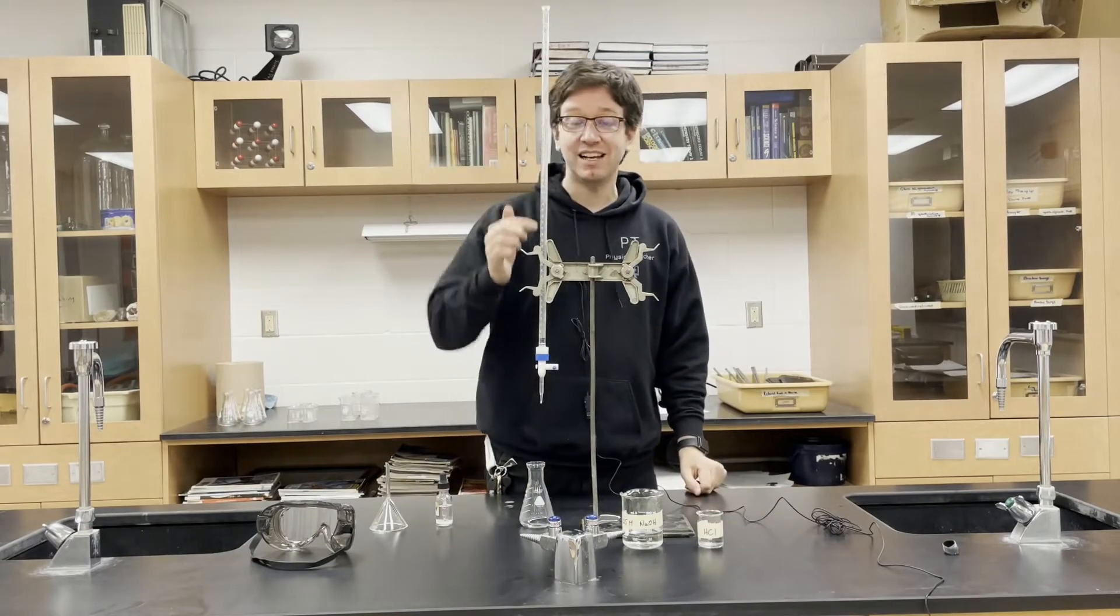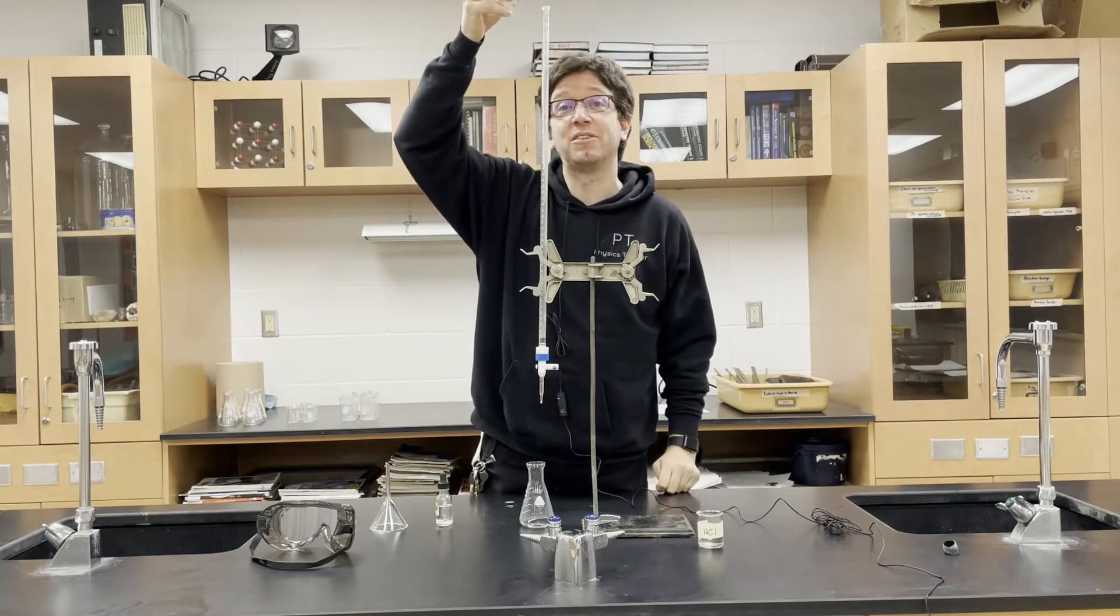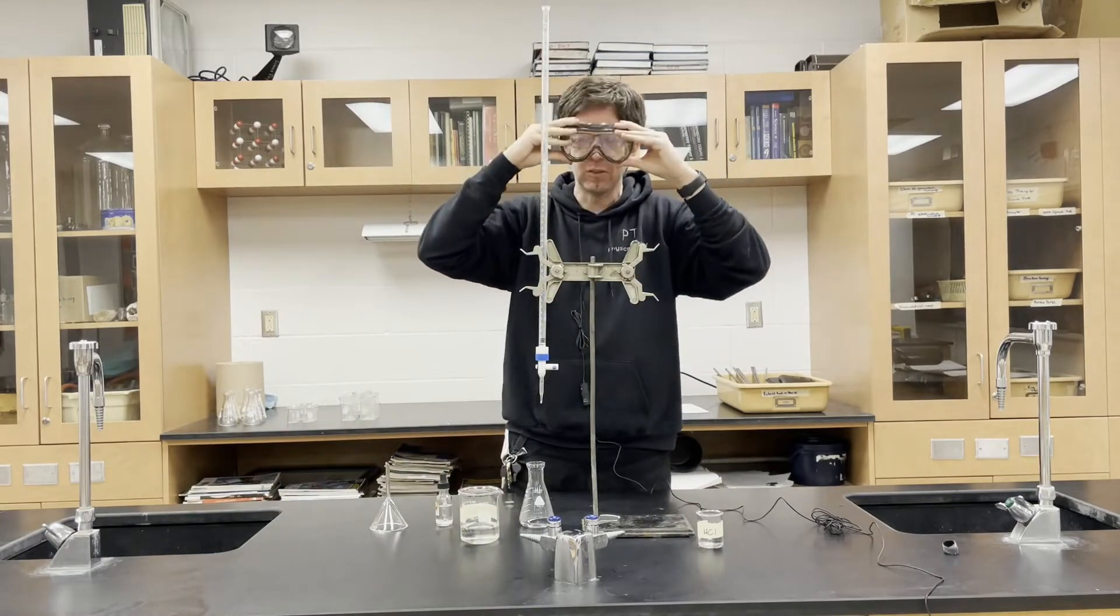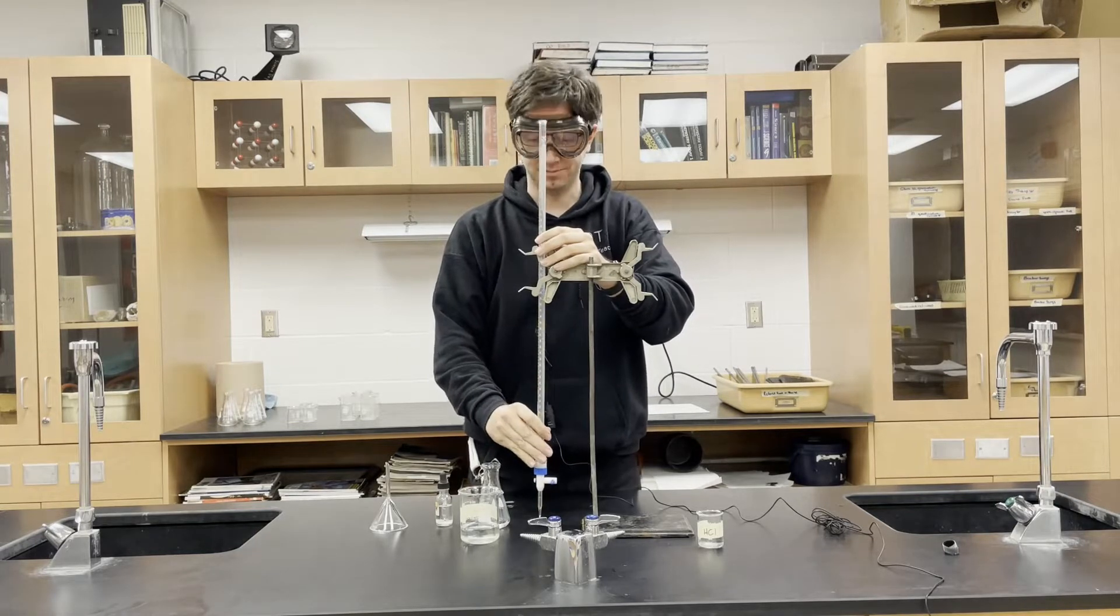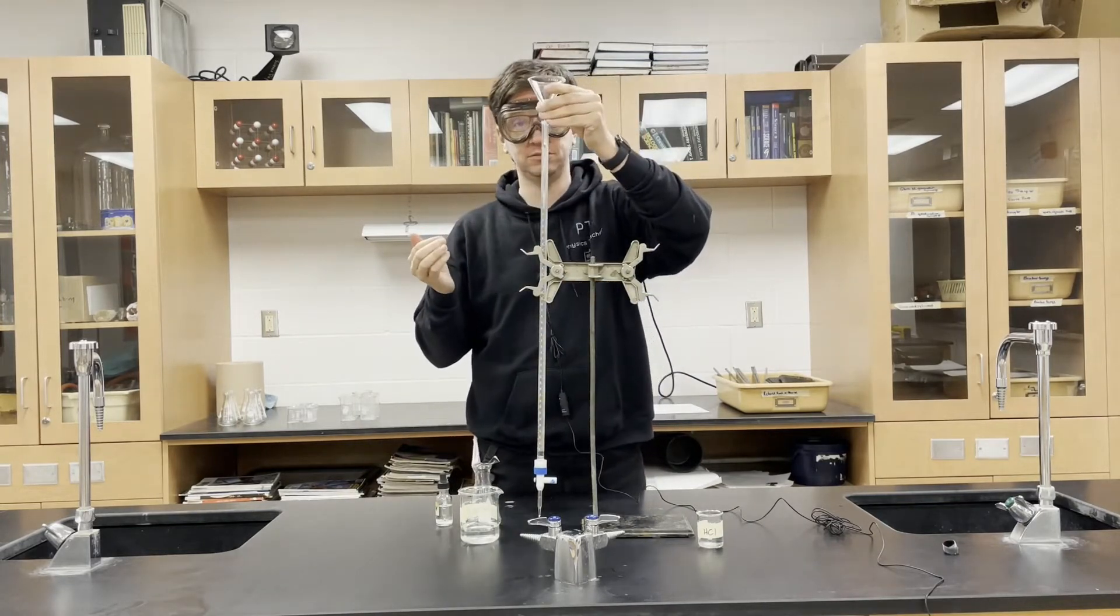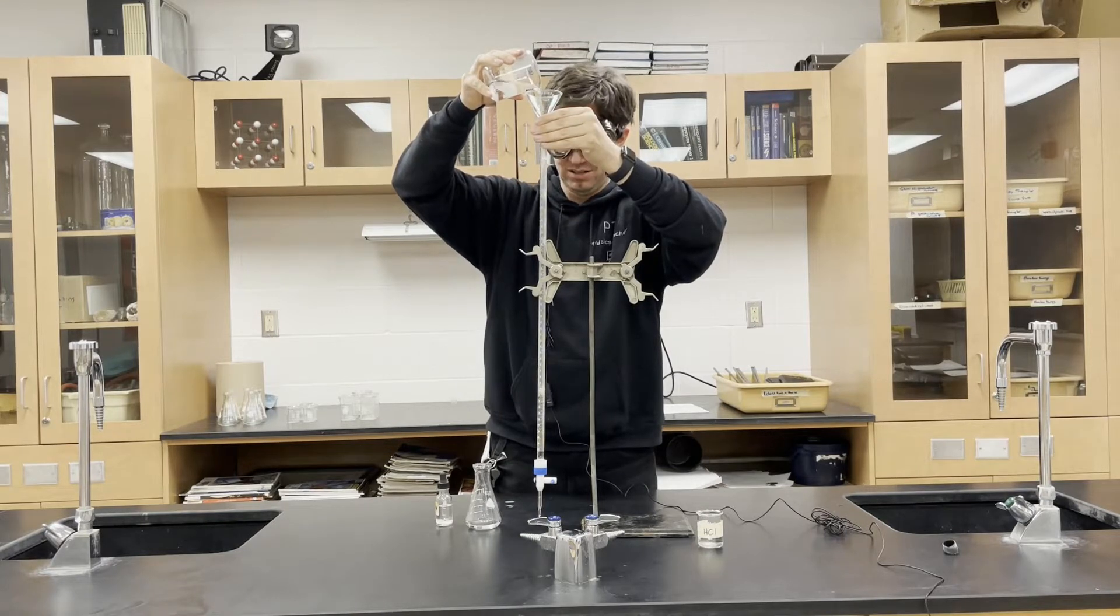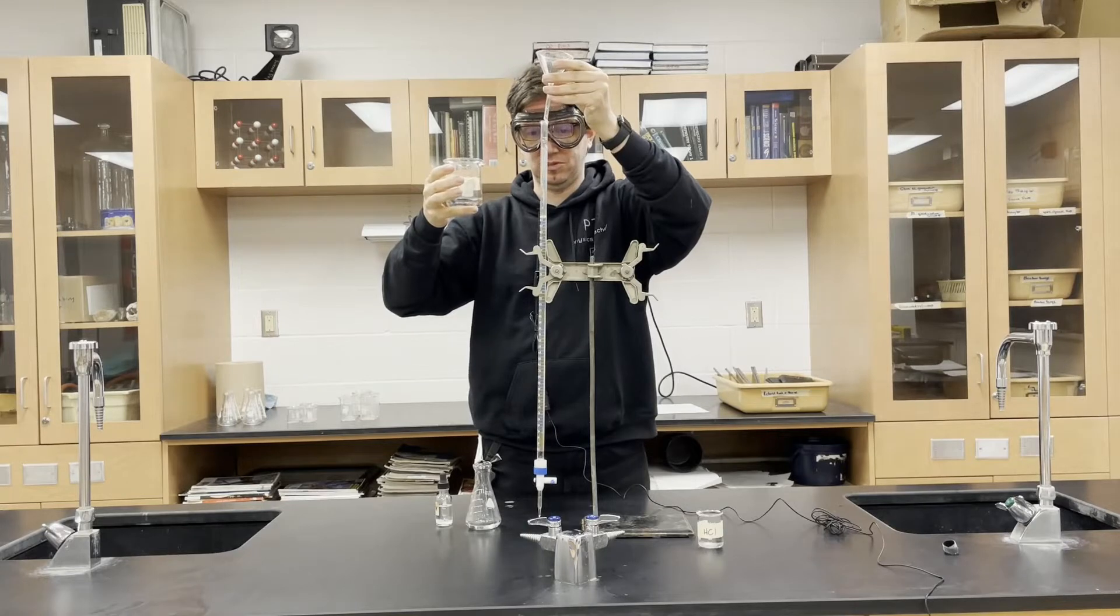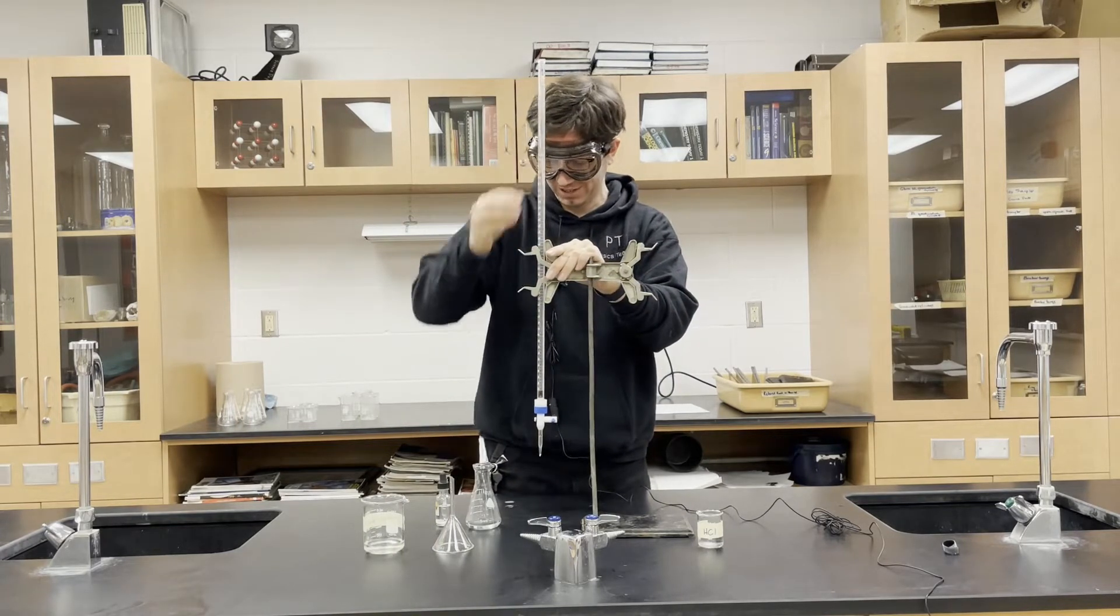Now I'm going to put sodium hydroxide into our burette. If the top of the burette is higher than your head, you're not going to lift it above your head. I'm going to put on my safety goggles and lower this to this level. If you need it lower you can remove it from the clamp. You don't need to pour in a specific amount, just enough.